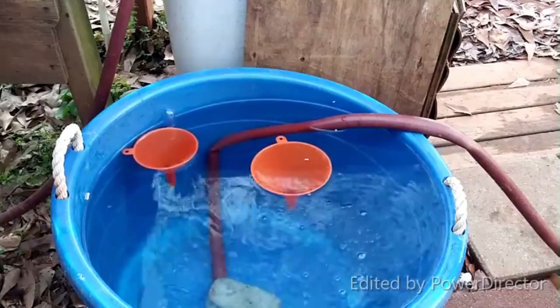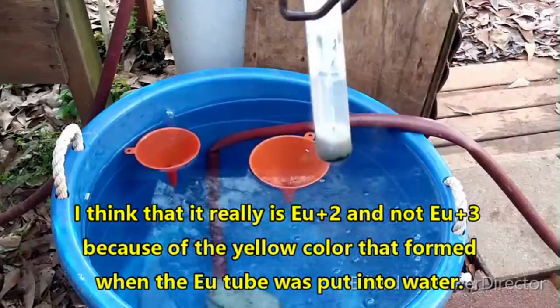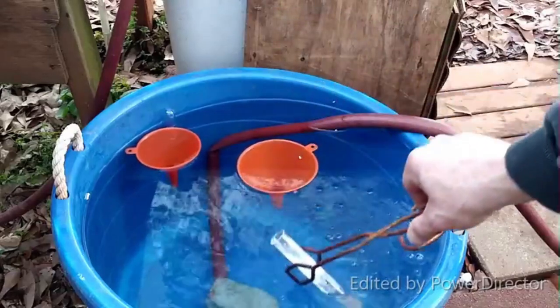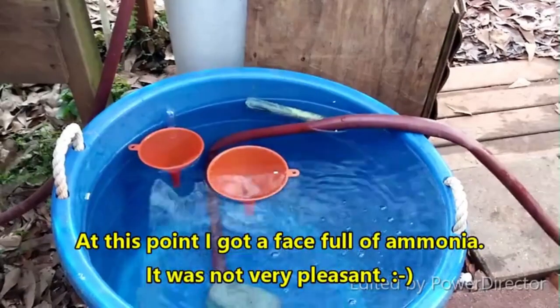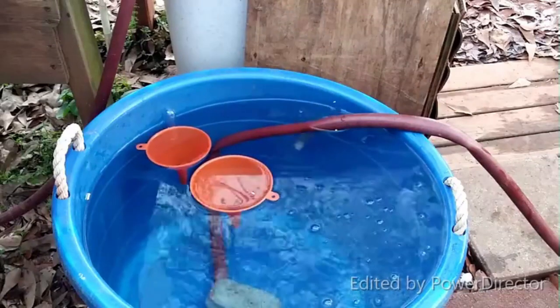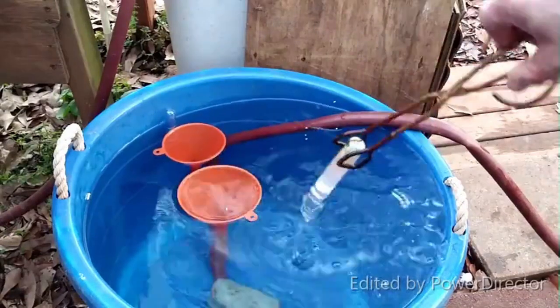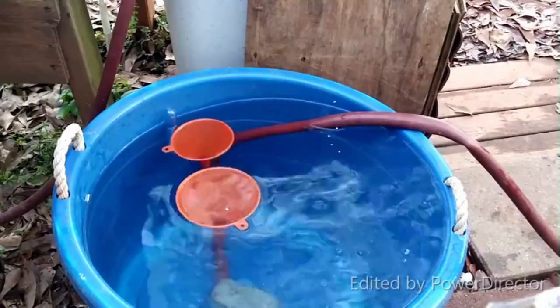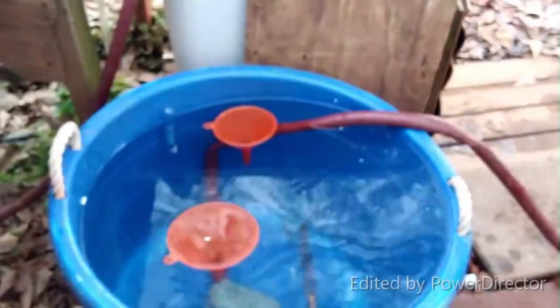That stuff must be europium(II) amide, because that would be non-polar and not very soluble. That one I'm actually a little worried about — let's find out. Oh — yellow! Wow. Oh, ammonia! Oh, that was nose-raping. Oh look, some fire! No — that's gold, look at that color! Oh, that burns. Whatever it is, it is really alkaline. Ow — lots of ammonia. I don't even care if that was nose-raping, that's worth a little nose rape.